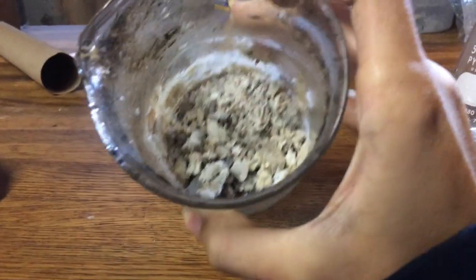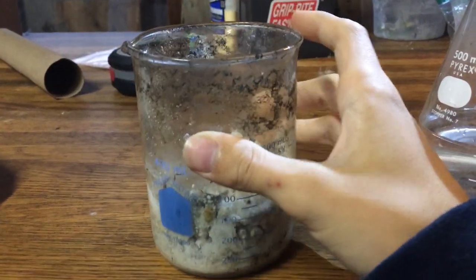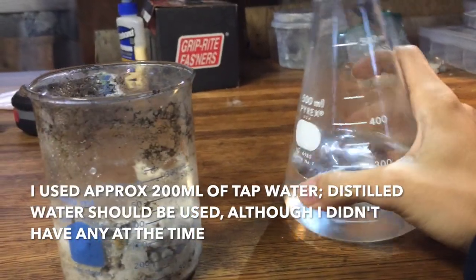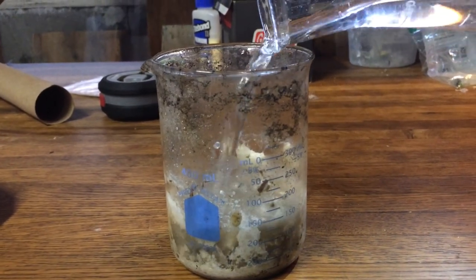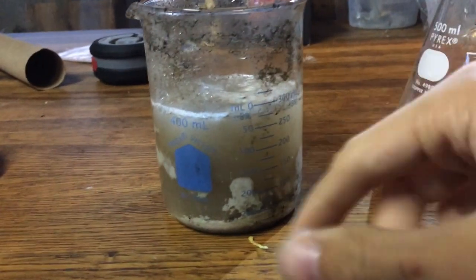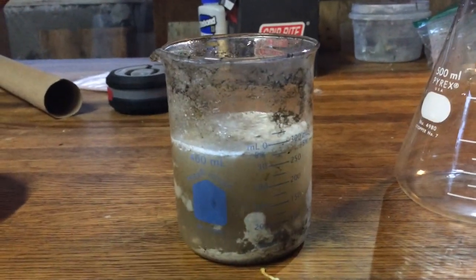I haven't been able to do anything with this calcium chloride and impurities mixture for the past few days, and it got a bit goopy. That shouldn't matter, though, because right now we're about to take approximately 200 milliliters, dissolve the calcium chloride, filter off the solids, and evaporate all the water off. Then we should have calcium chloride crystals.